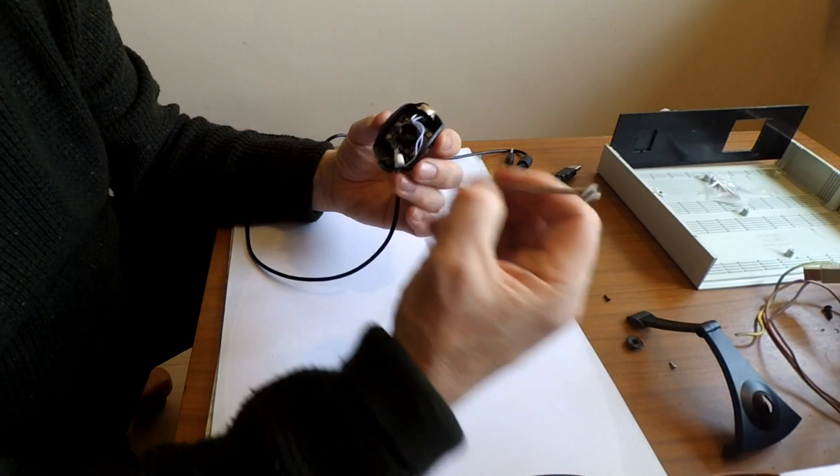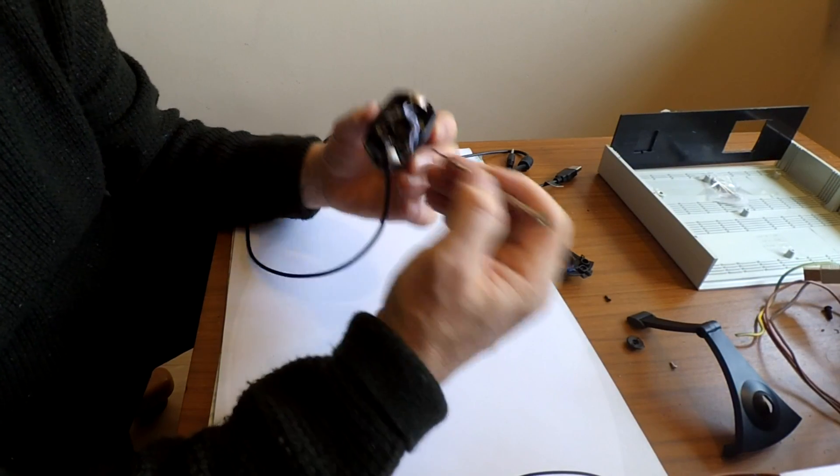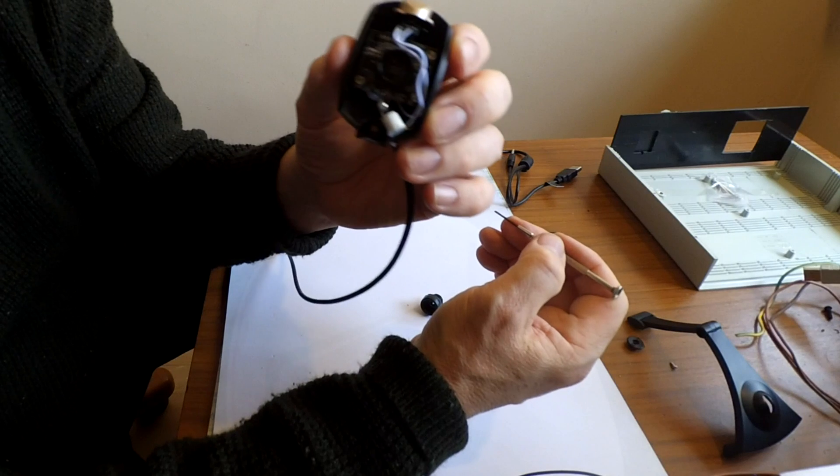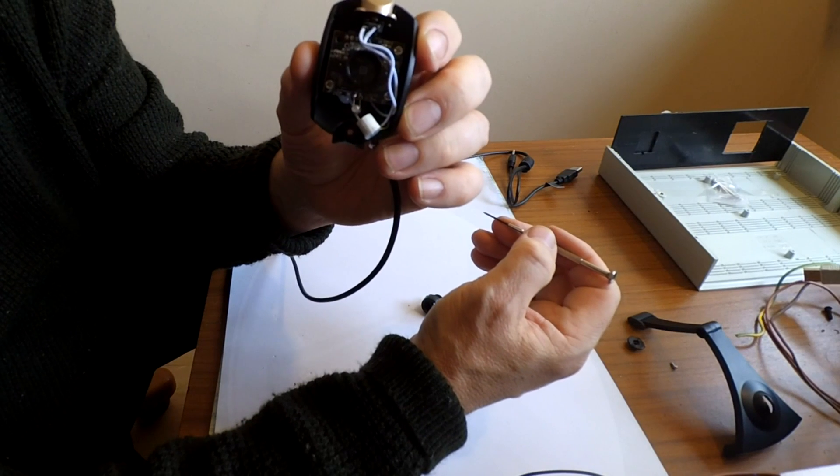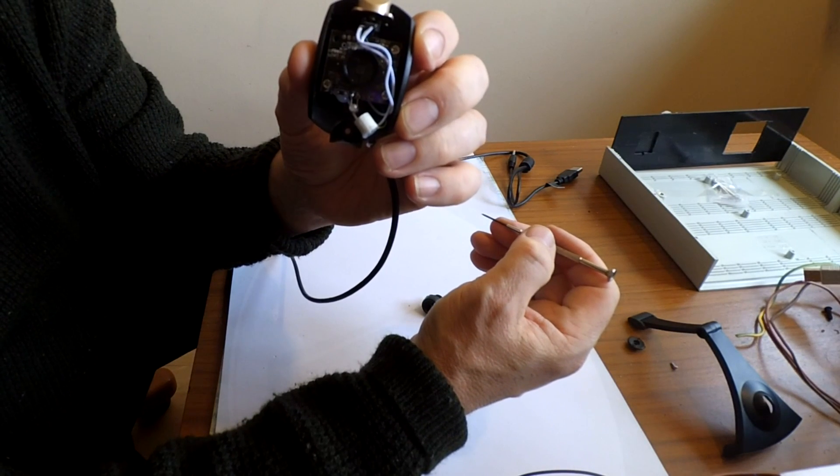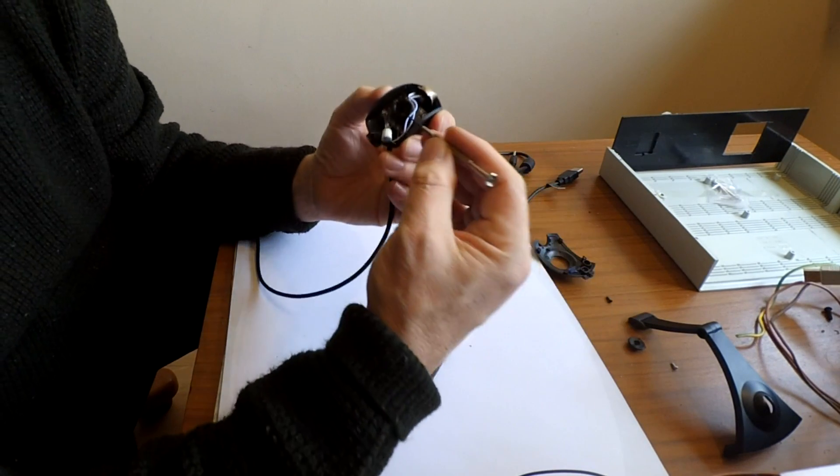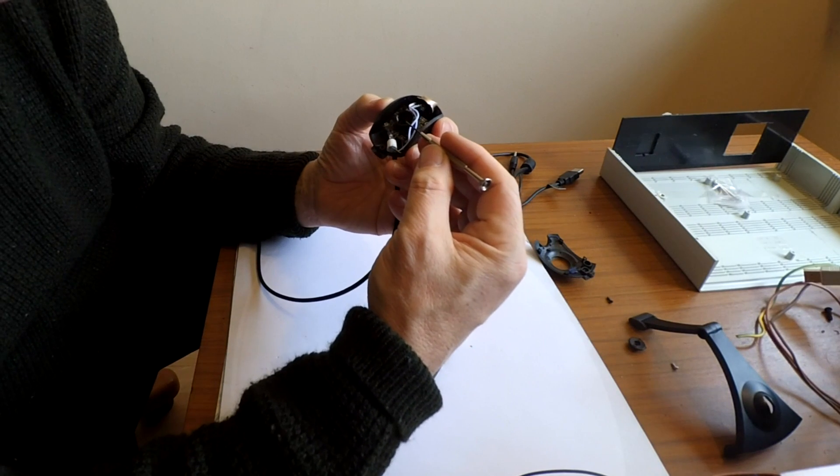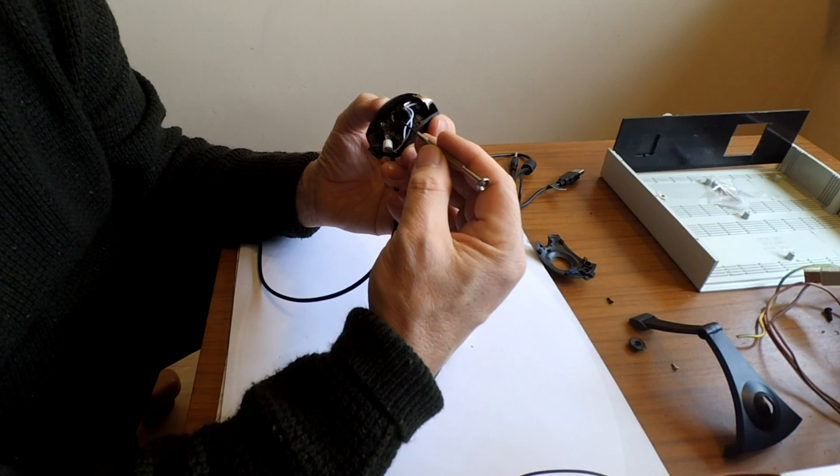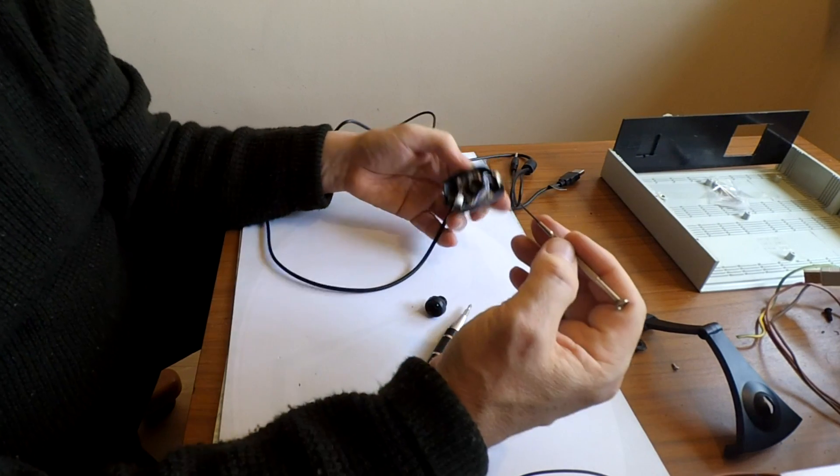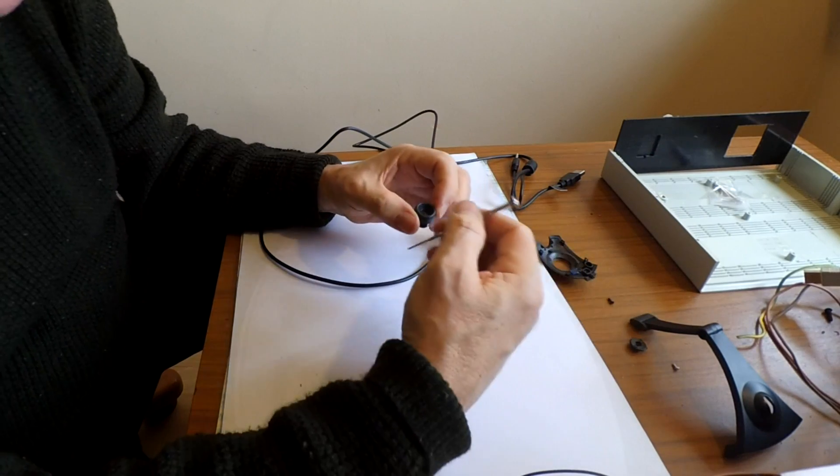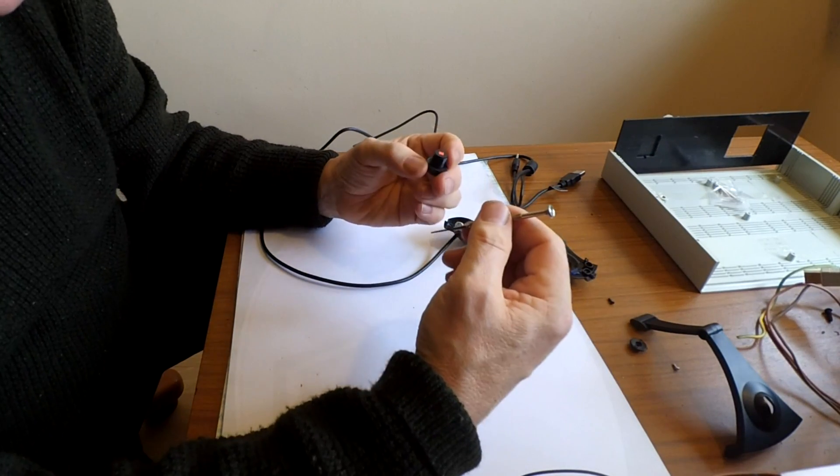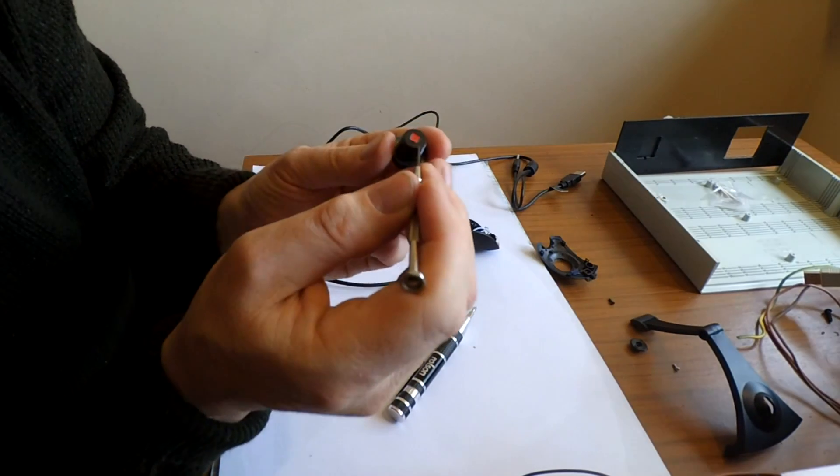You can see the sensor. I don't know if you can see the sensor, but the sensor is right at the bottom there. This camera probably won't focus close enough up, but the image sensor is down there. It's about 3mm square. This is the lens. And there is the infrared filter.